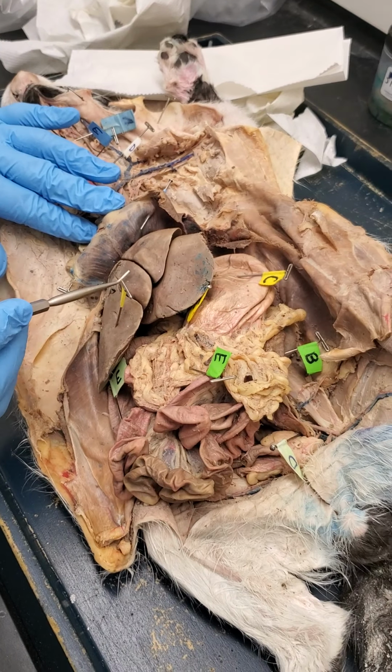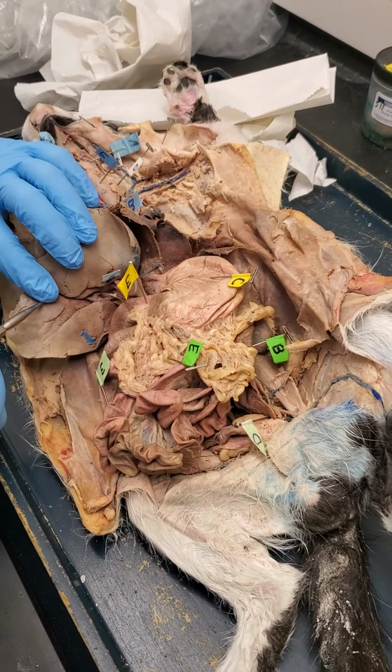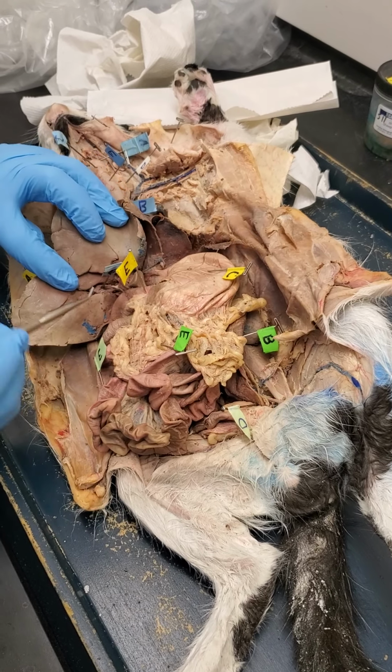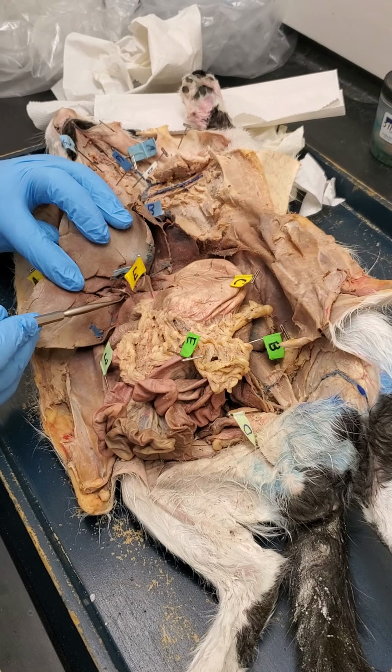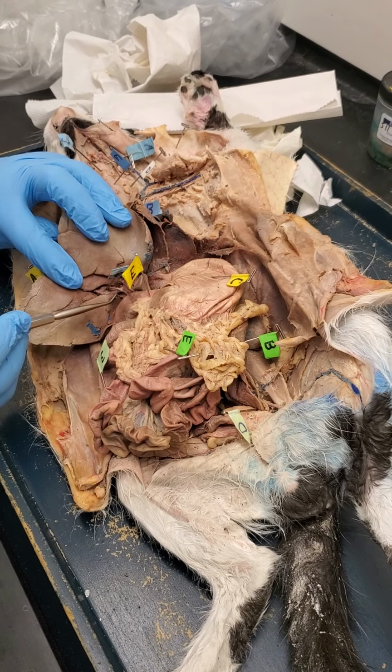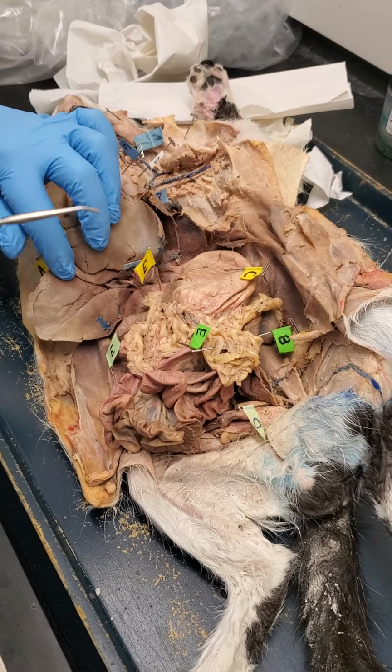This is obviously the liver. Okay. If we flip this up, you can see the gallbladder right here. Okay. I can't really get the ducts well defined here, so we wouldn't have to do any of the ducts.